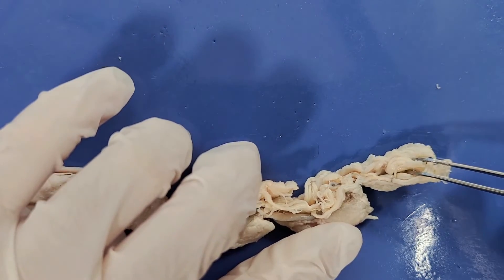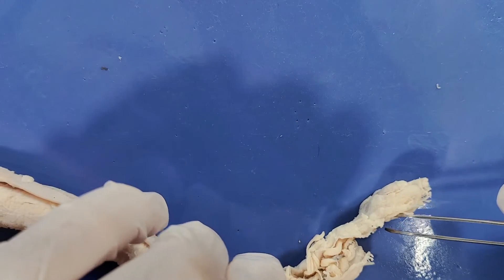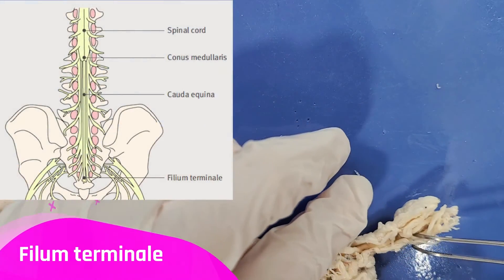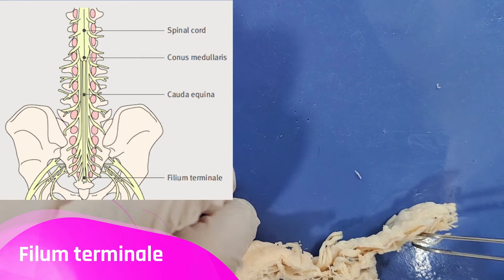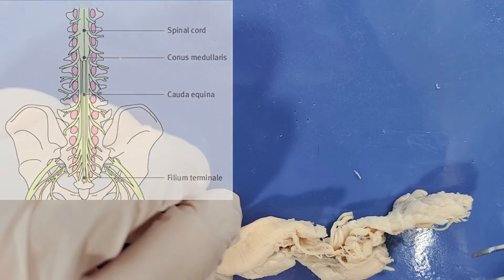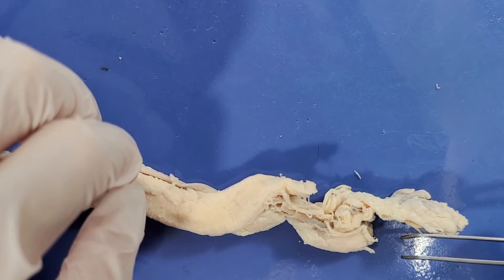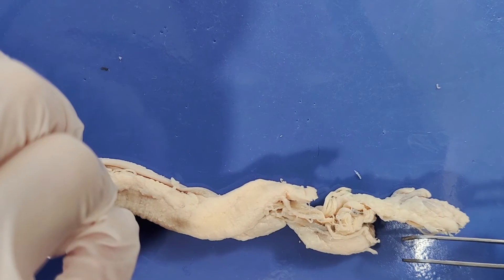Here in the middle of the cauda equina is a filament — I can't really find it here — but that filament would be called the filum terminale. The filum terminale does not consist of nerve tissue and is actually an extension of the pia mater that attaches to the tailbone and secures the spinal cord in place.